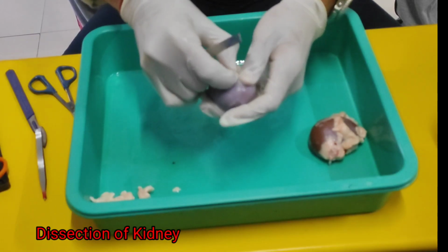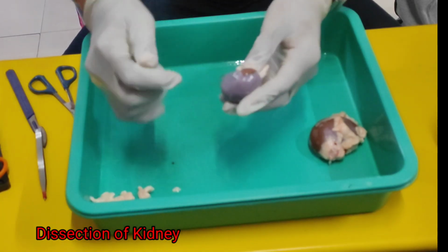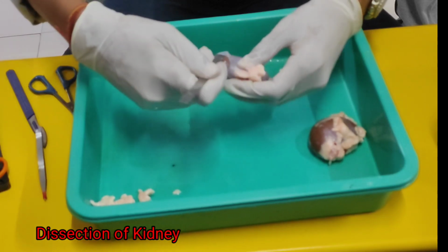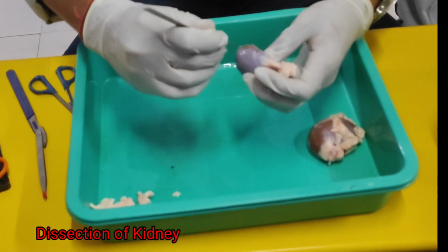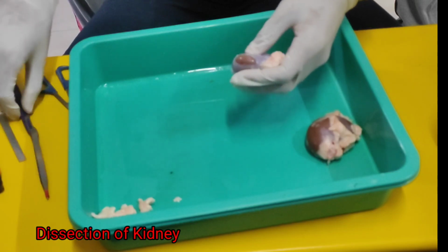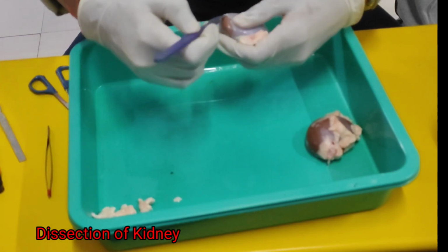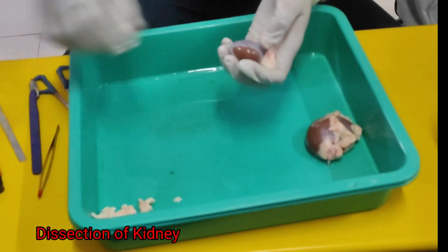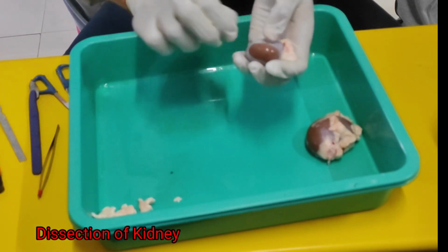This is one more layer. Kidney's upper layer, we have 3 layers over there. I'll explain it to you.